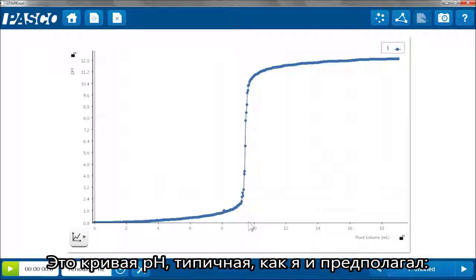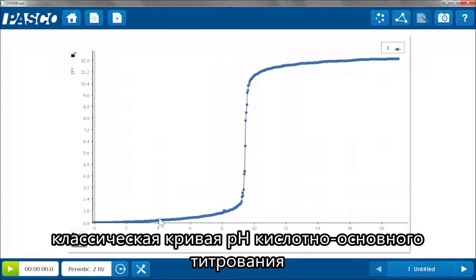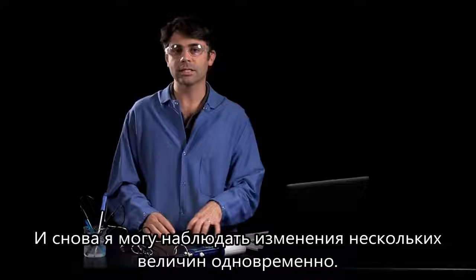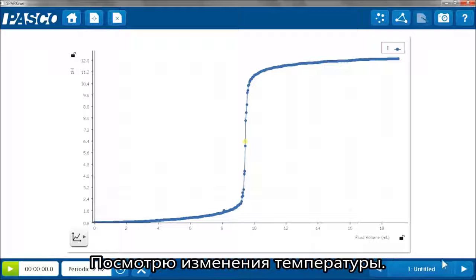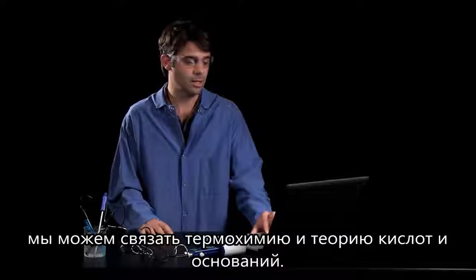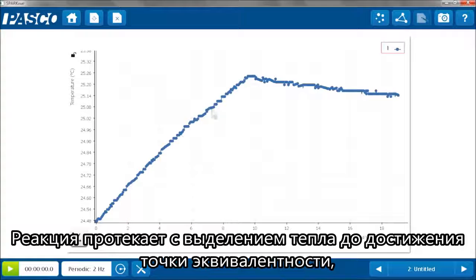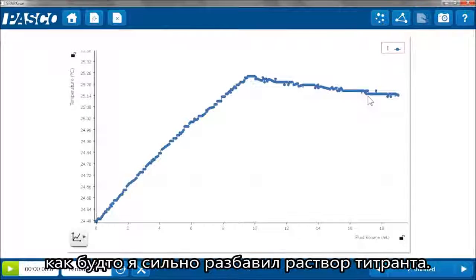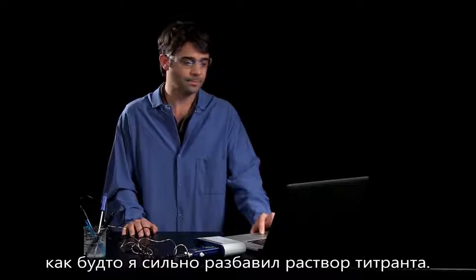So here's the pH curve, typical of what you would expect, a very classic pH curve for a strong acid-base titration with our equivalence point somewhere around 7. But again, the interesting thing is I can look at lots of other stuff at the same time. So I can look at the temperature. Now we can see this is an exothermic reaction and can tie in thermochemistry and acids and bases. The reaction kept heating up, giving off heat, until the equivalence point was reached, and then the temperature started to go back down as I was essentially just diluting the titrant that I added.